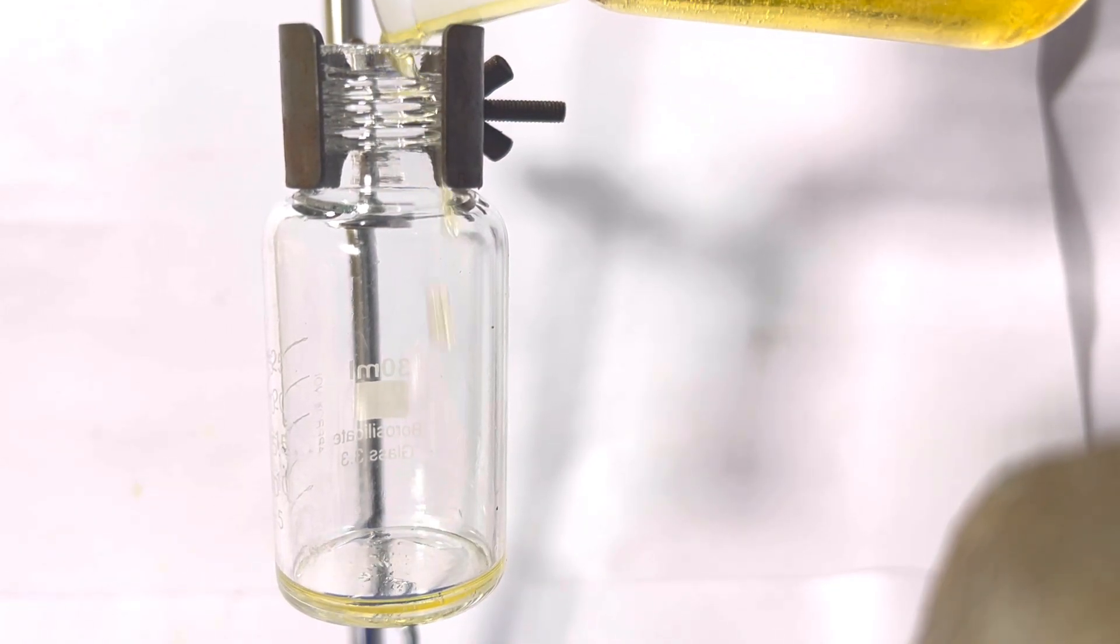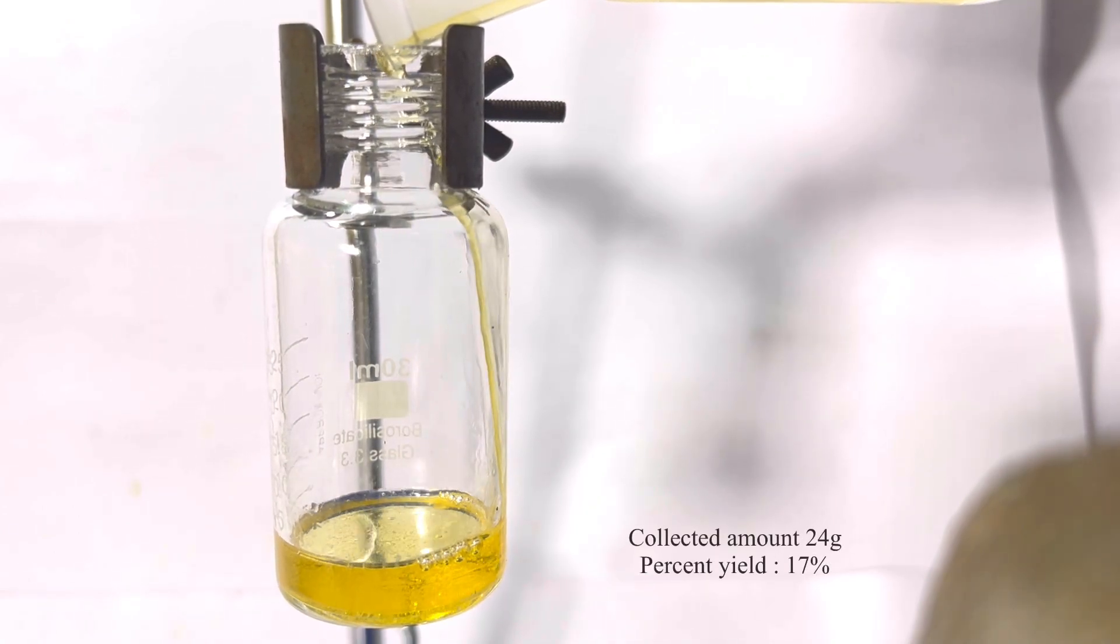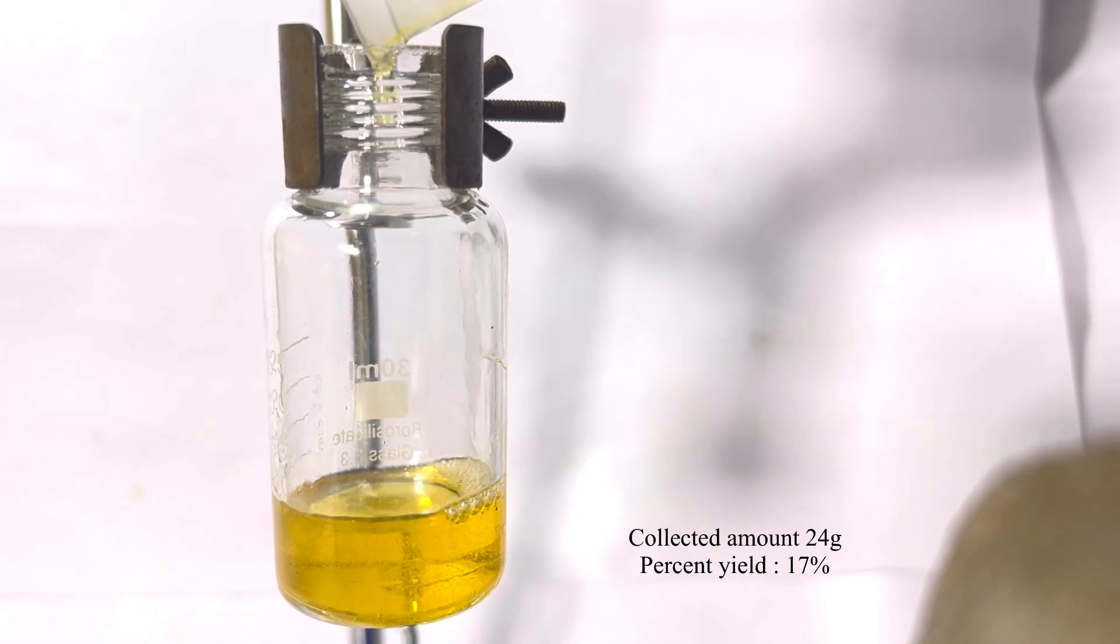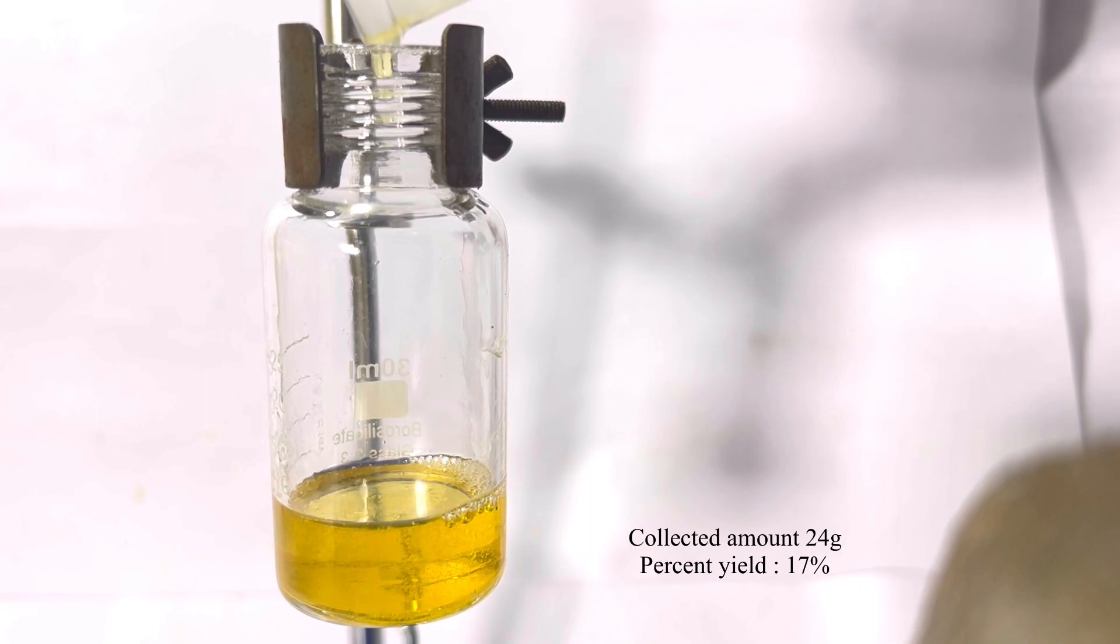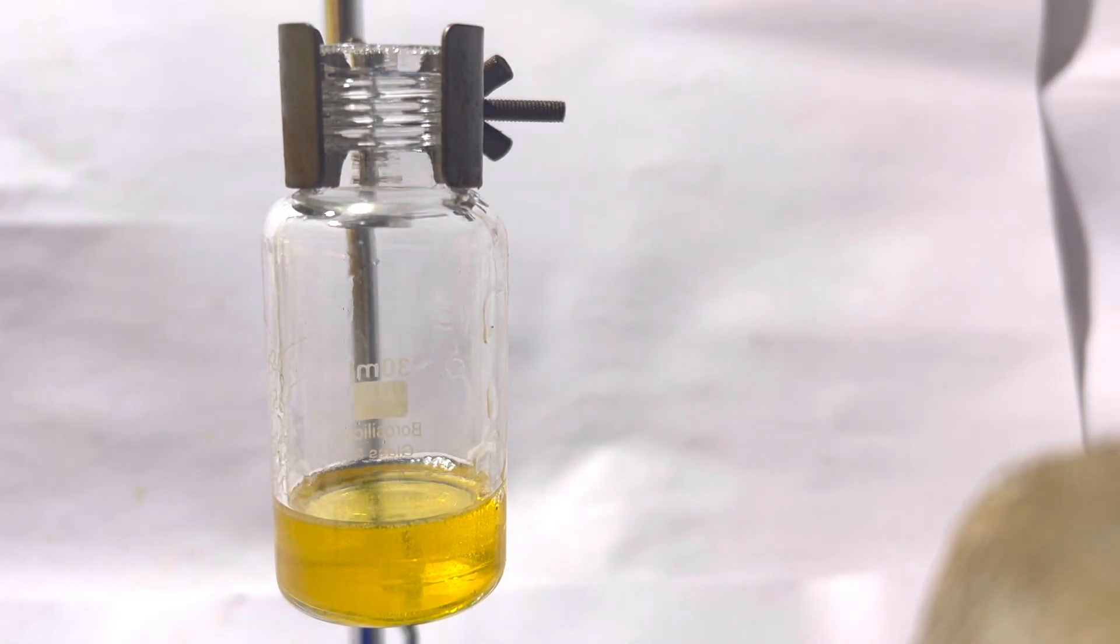I collected the distilled pure cinnamaldehyde around 24 grams. I know the yield is very low, it was less than 20 percent yield. The amount that was remaining in the distilling flask was much more than after distillation of benzaldehyde. But after distilling the cinnamaldehyde it is as if half of that just got distilled over. But whatever I got is very pure and beautiful cinnamaldehyde.